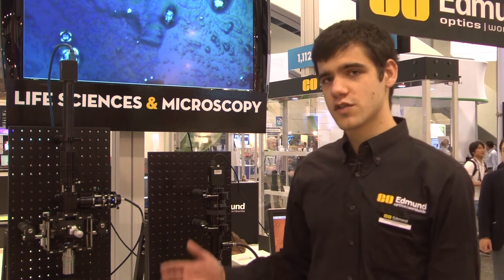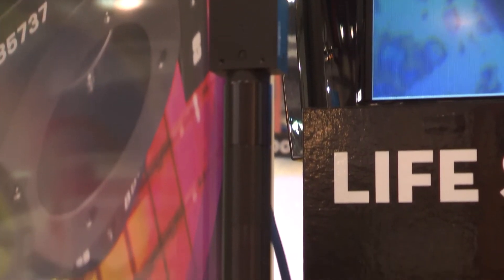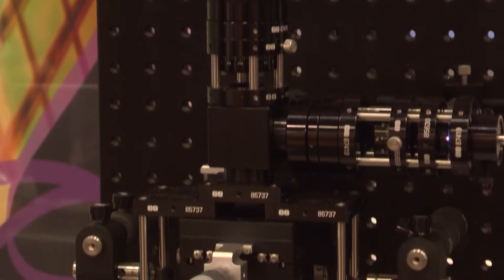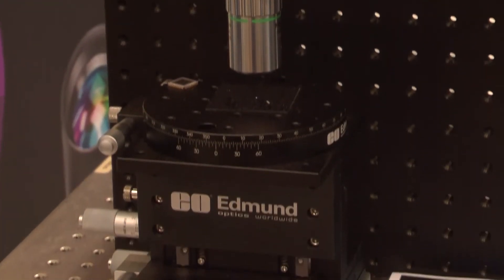We used our stock products to do that, and it results in a much more flexible setup. It shows that we have the design expertise necessary to help you with your projects and that we have the stock optics you need for your applications.